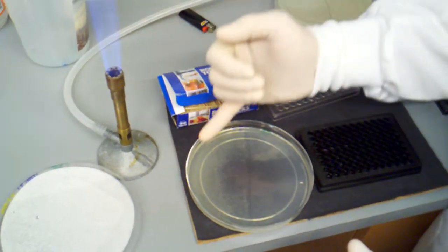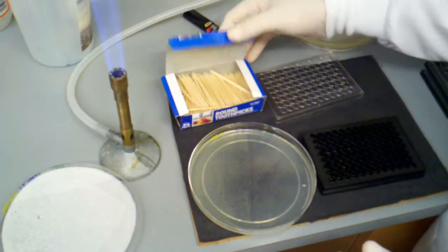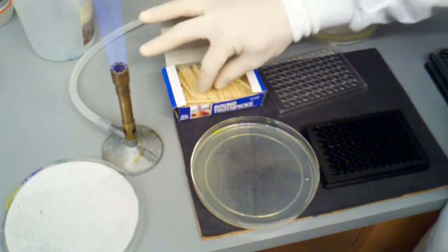If you pick them in an area that's too dense, then you might pick up multiple colonies, which is no good because that will throw out the results for our screen.